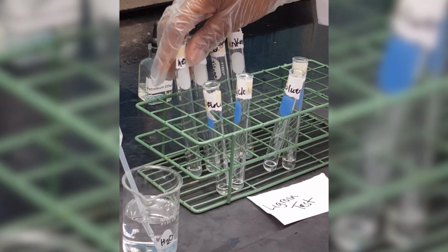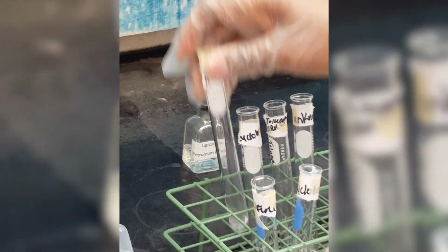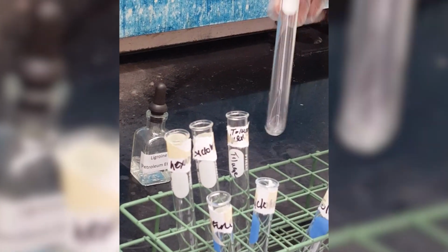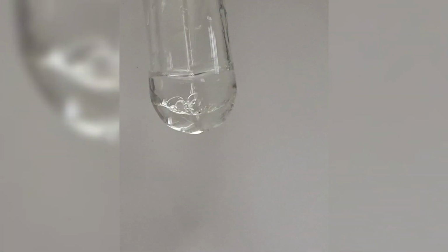Okay, so now I will mix each of the samples with water so we can see the mixing, see what it looks like. So now I want us to note: I mixed, added water to hexane. Is it soluble? That's what you want to ask yourself right now. Do you see 2 layers? Is it soluble? Are there 2 layers? When I mix, do you see 2 layers or is it clear?